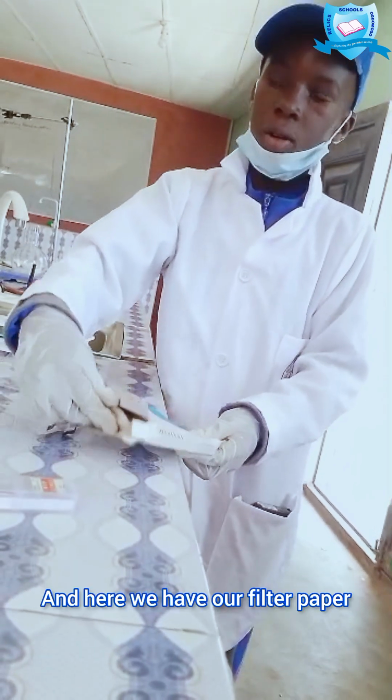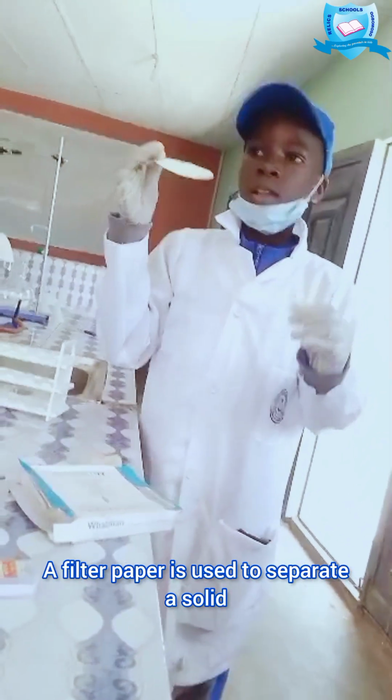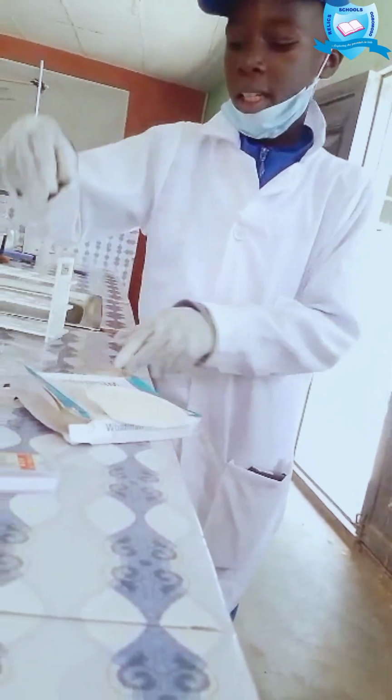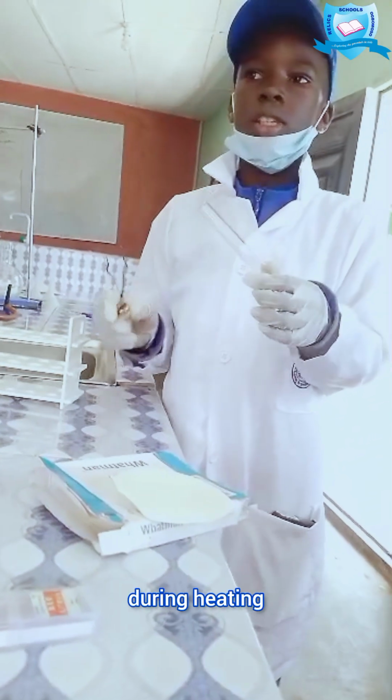And here we have our filter paper. A filter paper is used to separate solid particles from liquid or gases. And here we have a test tube holder. A test tube holder is used to hold the test tube during heating.